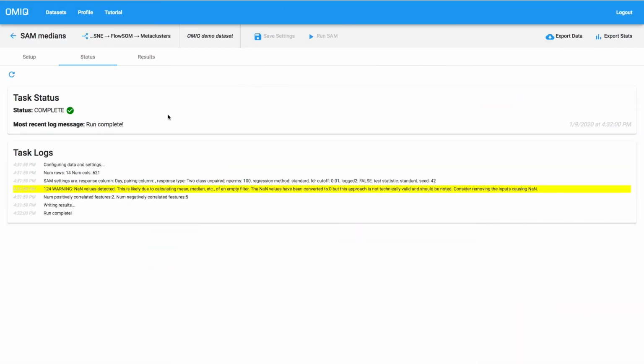Anytime you run a task in OMIQ, it can be useful to check out the logs. There could be important messages there for you. In this case with SAM, what can happen when we run with medians is that we get a warning about NaN values. And NaN is short for not a number.